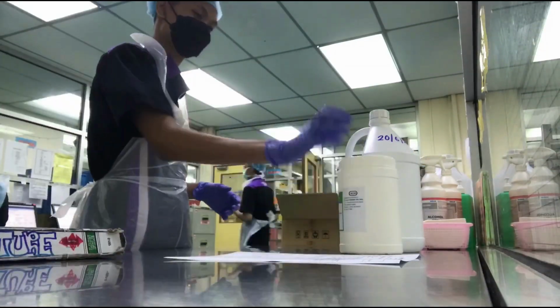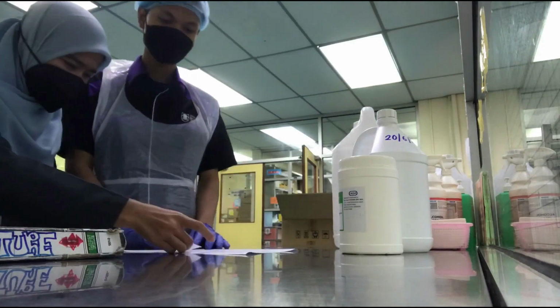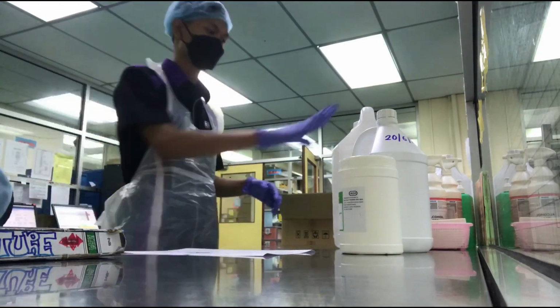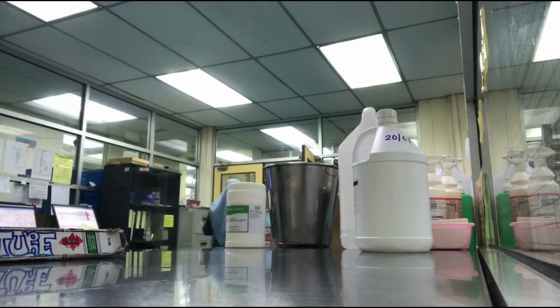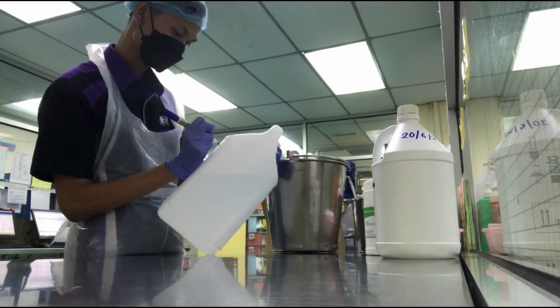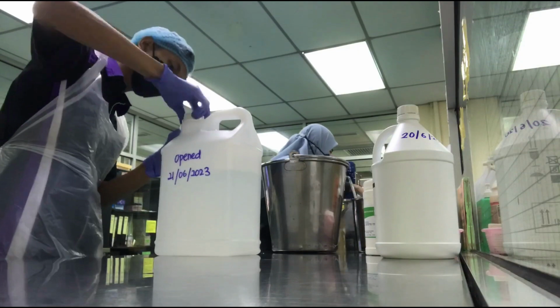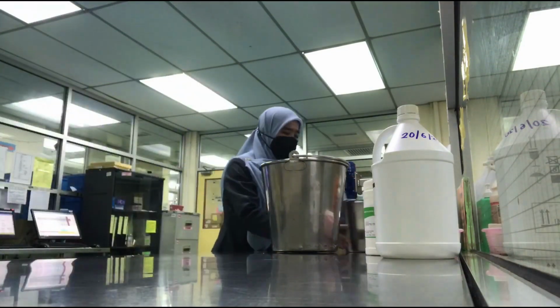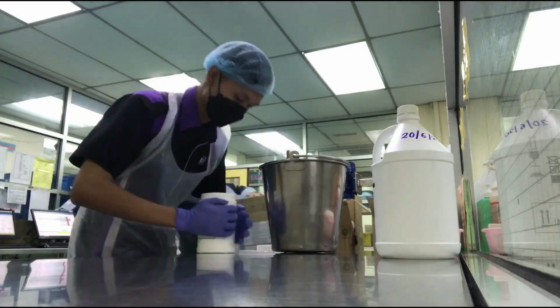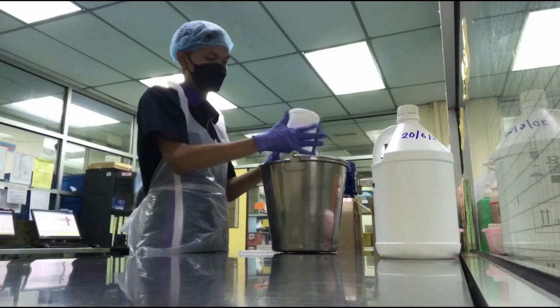After that, we will continue the process by checking once again each product's batch number, expiry date, and the name of the raw ingredient before we start to pre-pack or prepare any drug. We must make sure all the raw material info is the same as the worksheet. After we find out all the information is correct, we will proceed with the production of the medication.